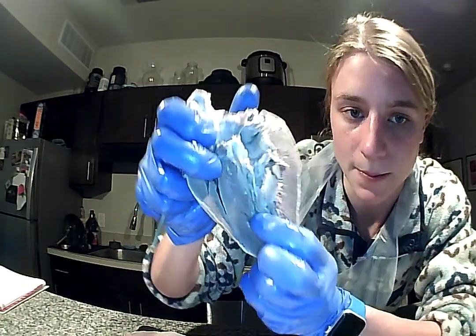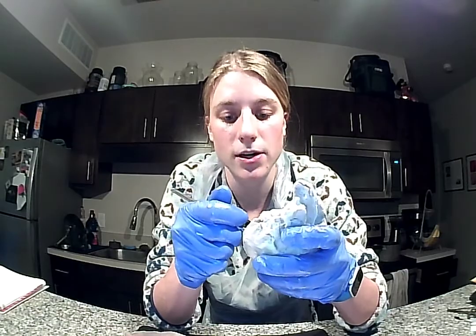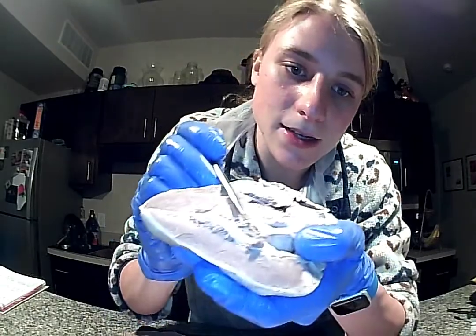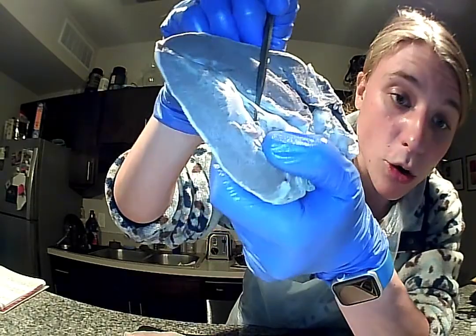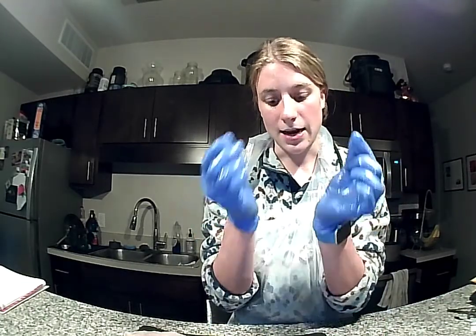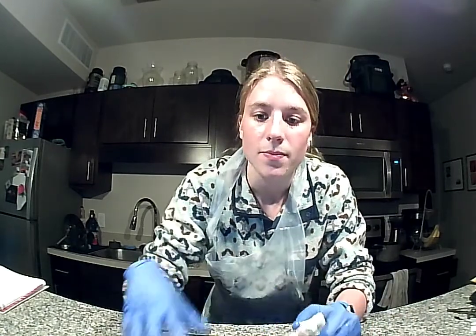So that's down here. So the valves, like I said, were destroyed while I was dissecting this, but you also see here these strings, your heartstrings, those are going to be your chordae tendineae. So that's what these are. And those function to hold that valve down and keep it kind of taut. So that's what those are used for.